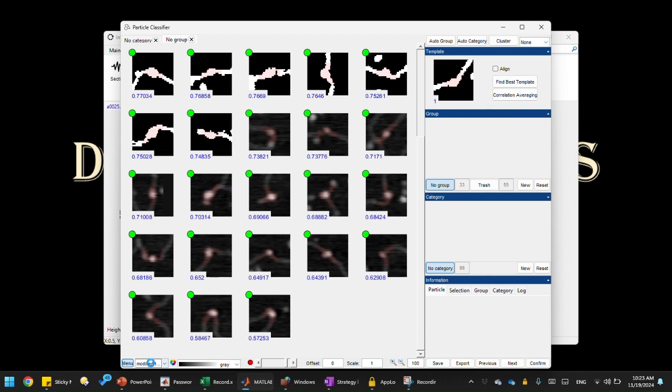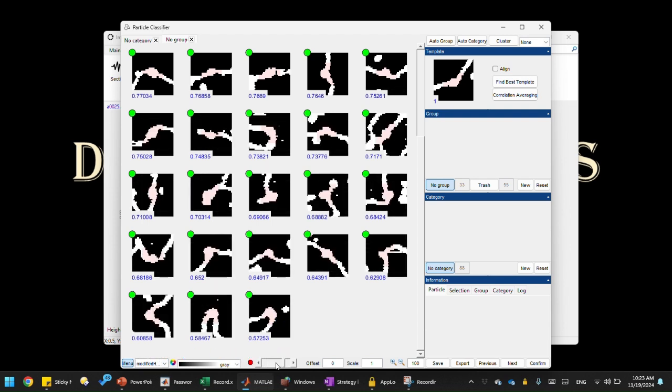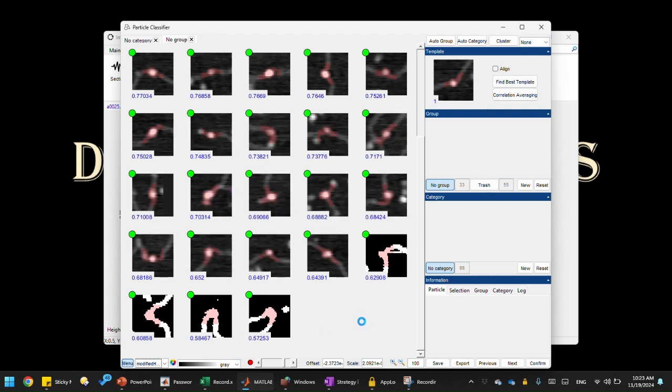Let's click that. So this is the binary image we created. What we are essentially using for our correlation analysis is this masked area in red in this binary image. These masks are what we use for our particle alignment and consequently for classification. That's the real data that we use for our classification, as I mentioned earlier. So let's go back to raw data. We're going to do a clustering analysis and see how well this does, whether it resolves the DNA bending species better than using raw data. Currently we're using the masks for our correlation analysis instead of using raw data.